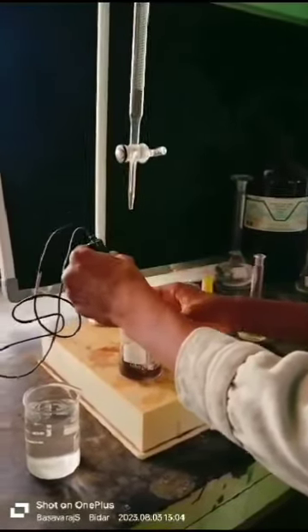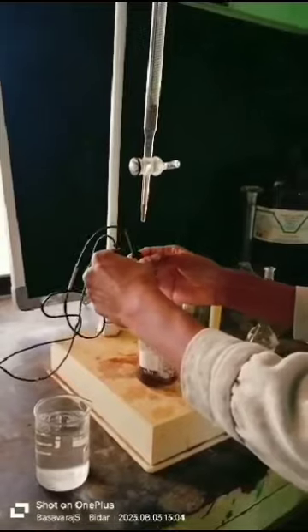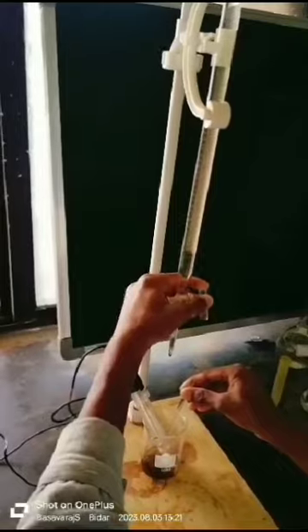We have calibrated this instrument using a pH 4 buffer capsule. pH is the negative logarithm of the concentration of H+ ions.